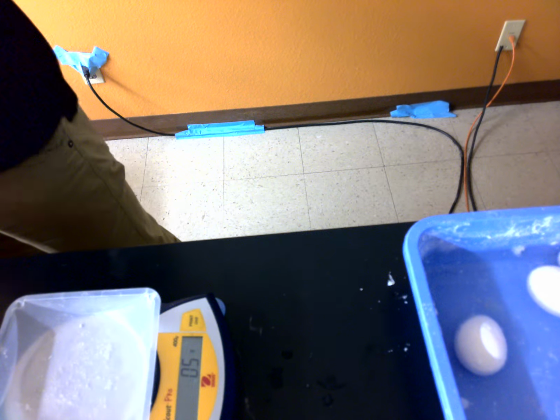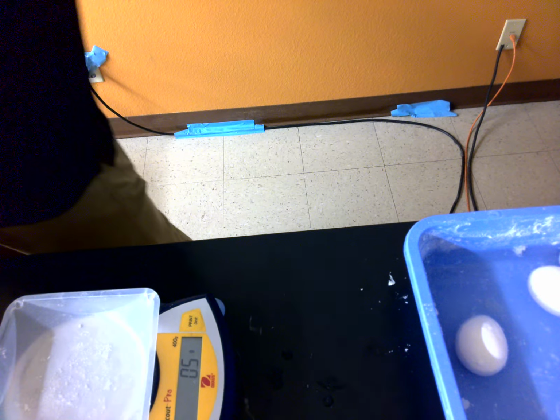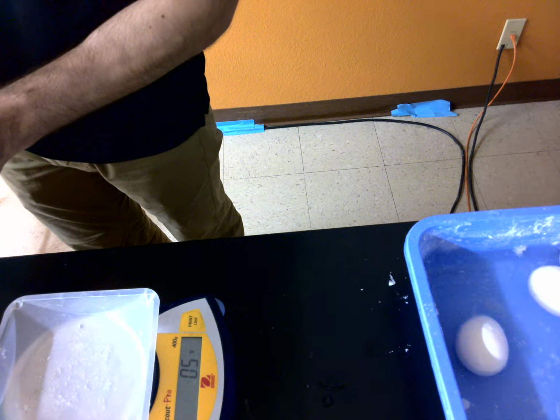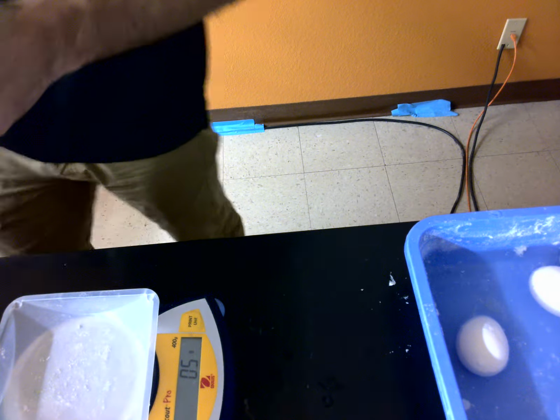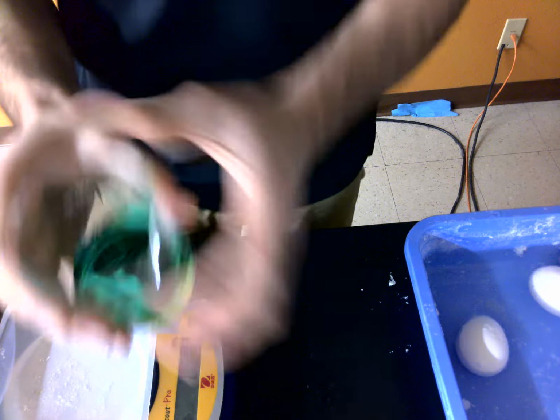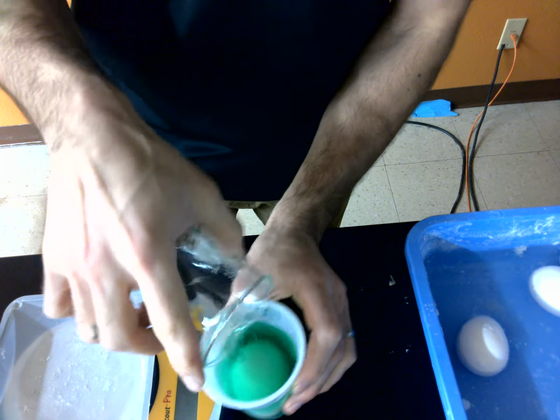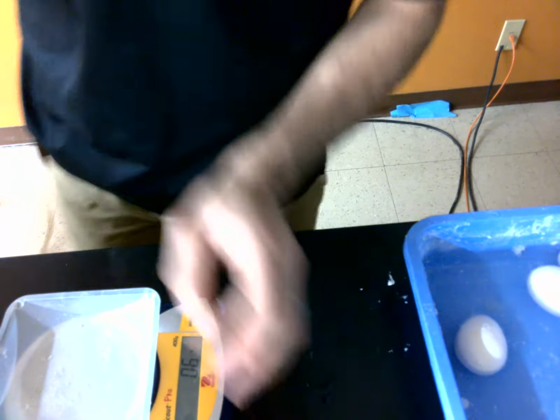And then let's go to the second one. So I'm going to go to the 100 gram per liter solution. Fill that one up. We need the 200.